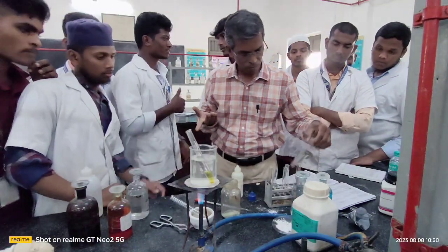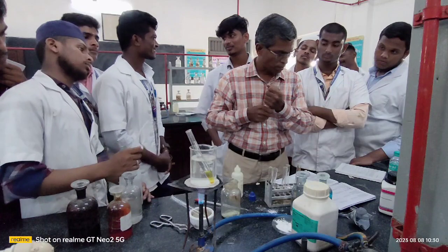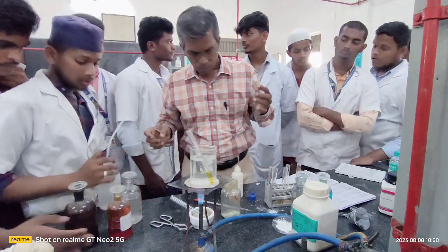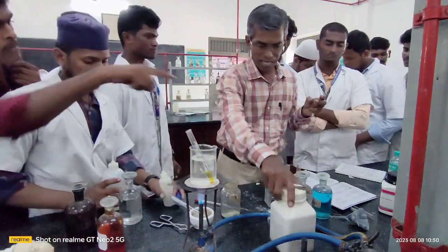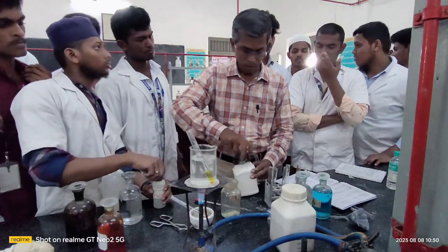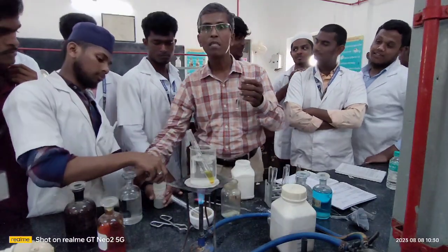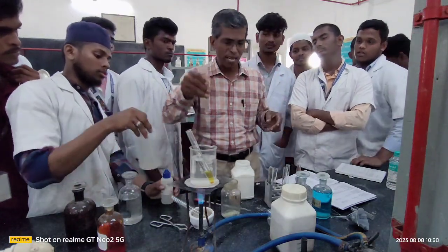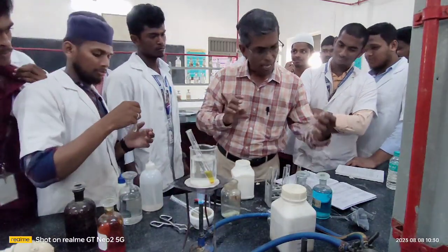Give me a fresh test tube. There is fat. There is carbohydrate. You take a little of carbohydrate, you add water as I told you, and keep this solution ready. This is test tube 1. In test tube 1, please keep it. You take another test tube.